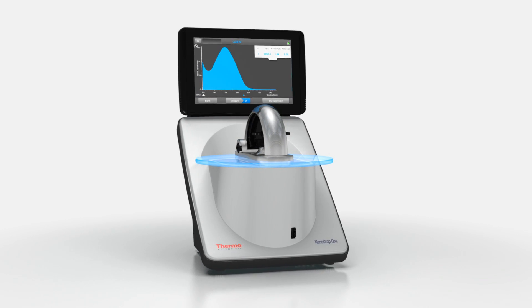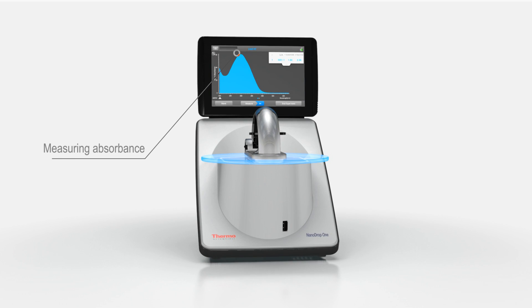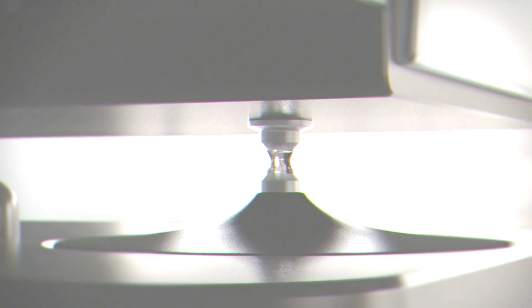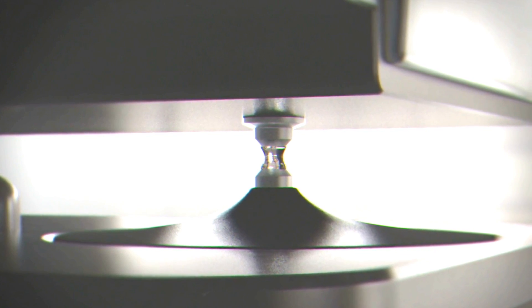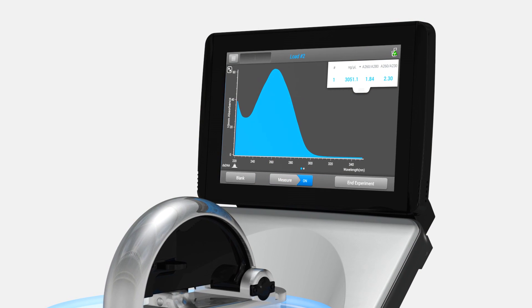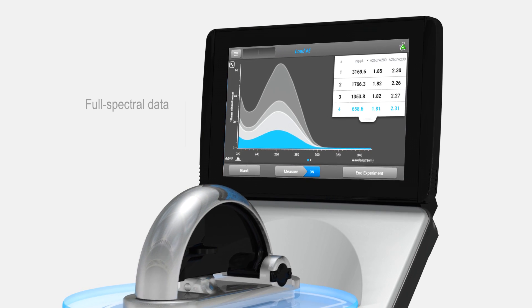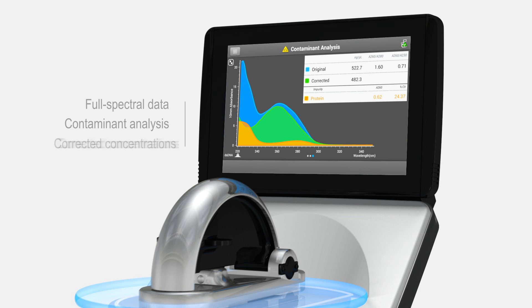The NanoDrop One instrument determines the concentration of total nucleic acid by measuring absorbance at 260 nanometers. A one-microliter sample is loaded directly onto the measurement pedestal. A liquid column is formed and the sample's absorbance is measured. The NanoDrop instrument provides an absorption spectrum for each sample, which can provide information about sample purity or presence of contaminants.